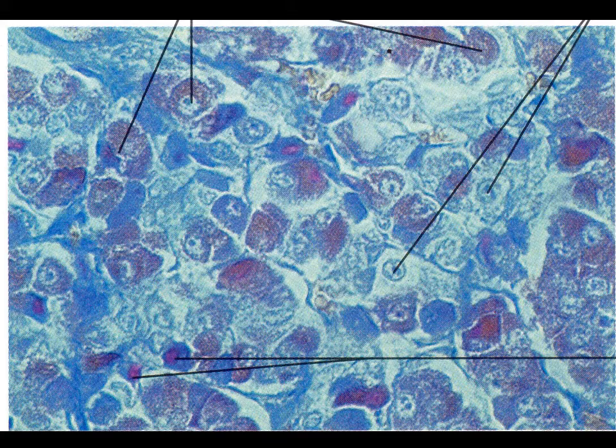And so we'll start with the chromophobes here. Chromophobes are essentially, as the name implies, afraid of color. And so here we have a chromophobe. And here's another chromophobe in there. And so their cytoplasm doesn't really take up any stain, so they don't have any coloring to them. Versus an acidophil is going to stain on the red side in terms of the cytoplasm there. So all of the cytoplasm portion is a redder color.